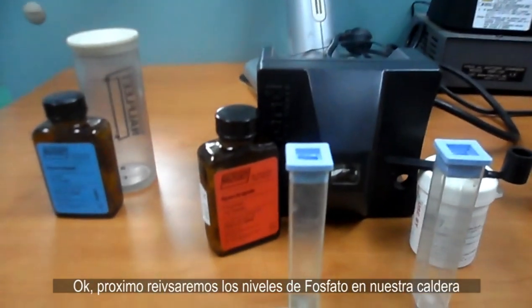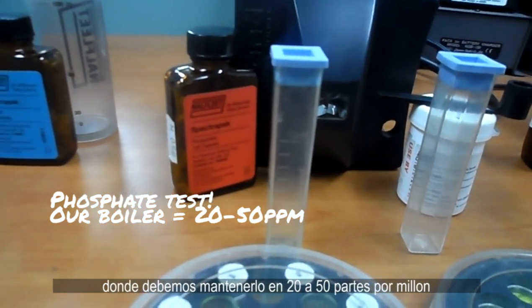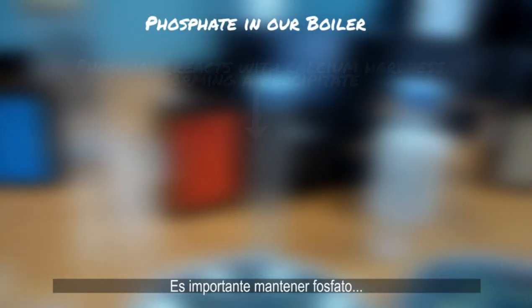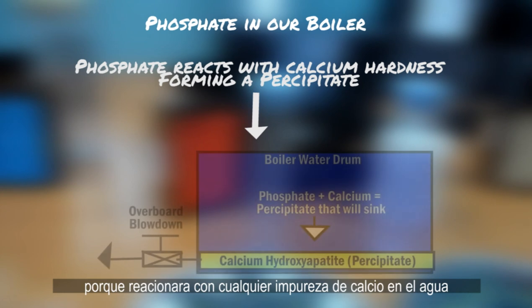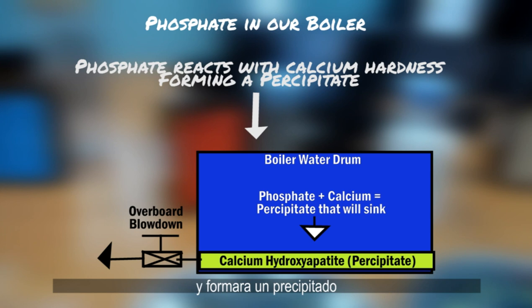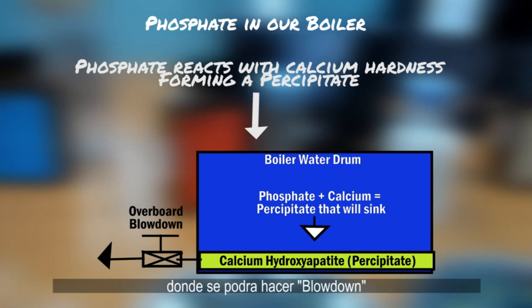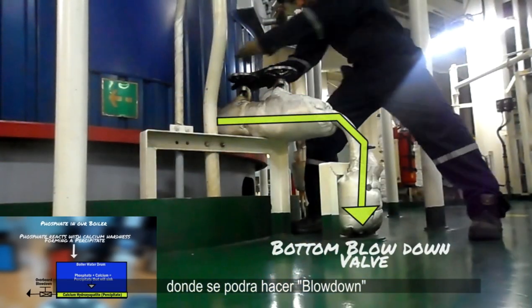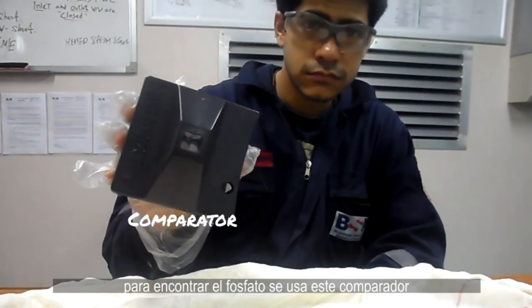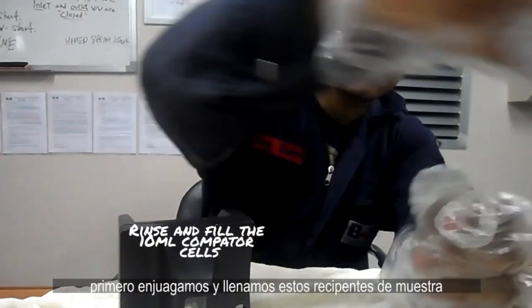Next, we check phosphate levels in the boiler water, which should be maintained within 20 to 50 parts per million. Phosphate is important because it reacts with any calcium impurities in the water and forms a precipitate that accumulates at the bottom of the boiler, which can later be blown down or discharged.